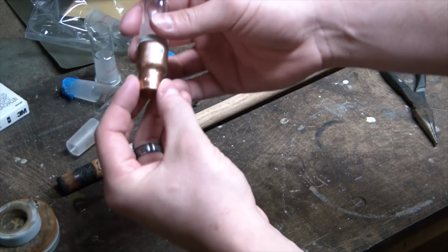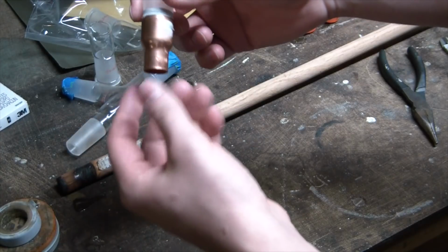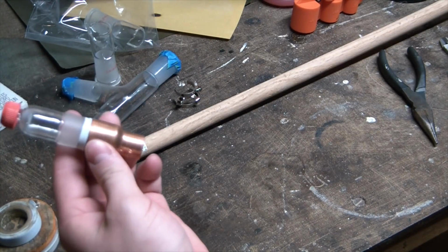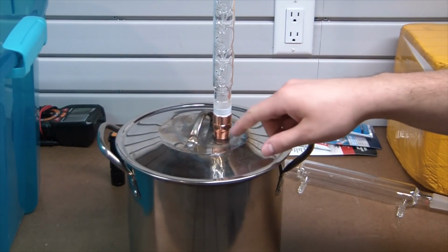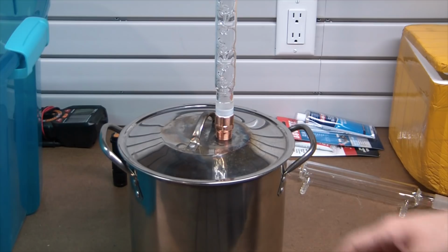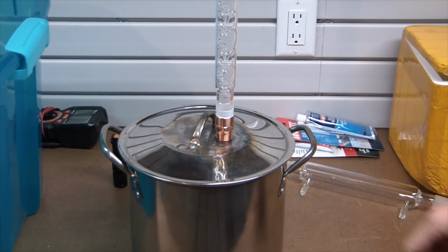Just gonna drill a hole in the top of the pot, flux these, obviously brush them up, flux them, and then braze the copper insert right into the stainless steel stockpot lid. We should be good to go. Well, I couldn't get the solder to work. It's probably this cheap Chinese grade of stainless steel garbage, and solder wasn't able to adhere to it.